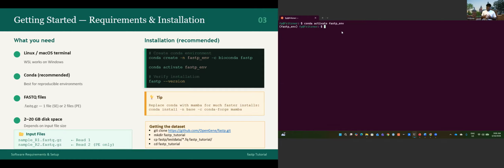Before we proceed with the fastp analysis, we need to have the data. I have some data I found on the OpenGene GitHub account. It is publicly available. I use a small set of data for the purpose of this tutorial. So we need to clone the repository. You can use git clone followed by the URL of the repository. Let me just type it because it is not that long. But if it is long, I would copy and paste it.